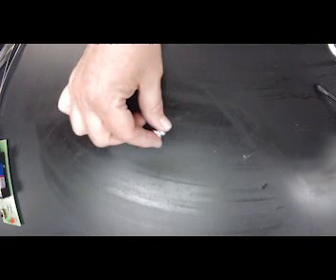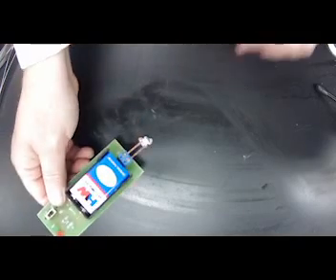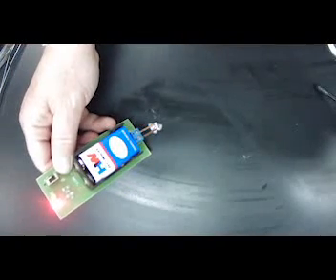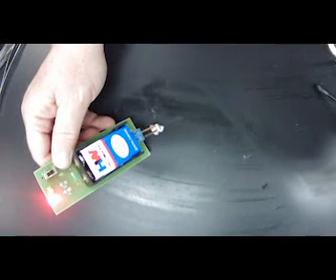It may start out this way. It has a little bit of luster, which metals should have. And the other thing we want to see, does it have conductivity? So let's go ahead and test it. And as you can see, my red light has lit up. Aluminum does conduct electricity. So you will put that in there, does conduct electricity. So that is aluminum.